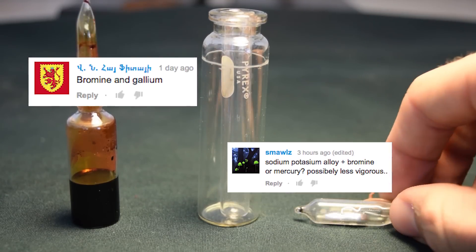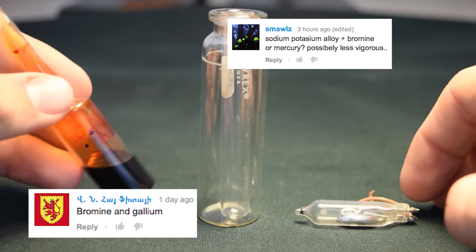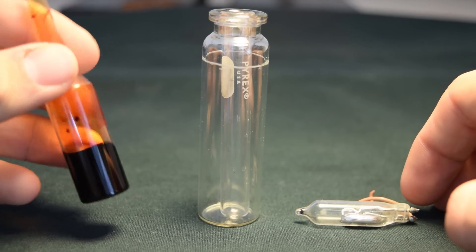A couple of you suggested that I react it with gallium and mercury, and since I don't have gallium, I'm just going to do mercury.